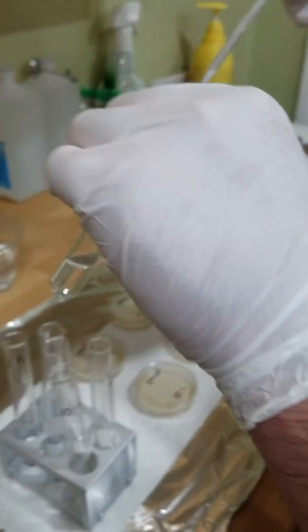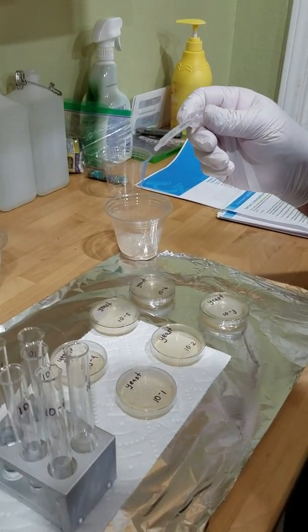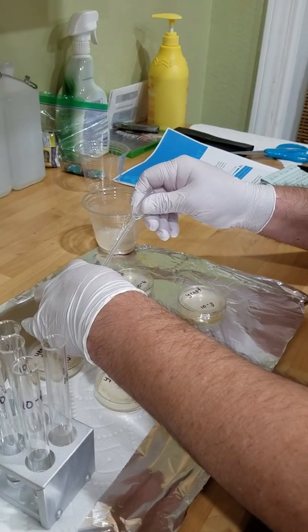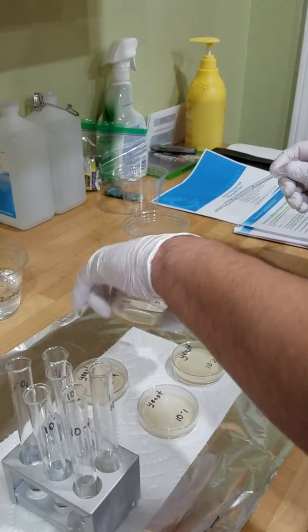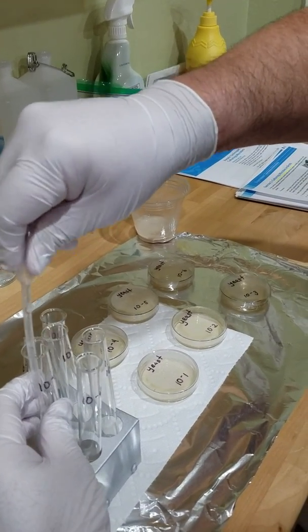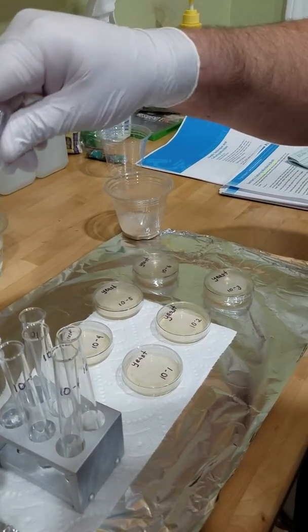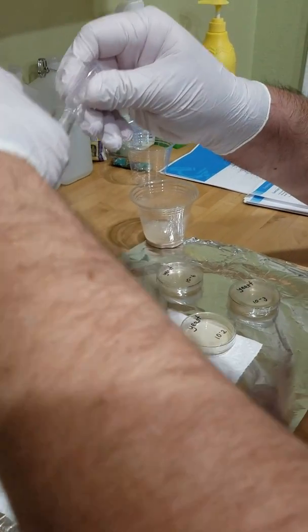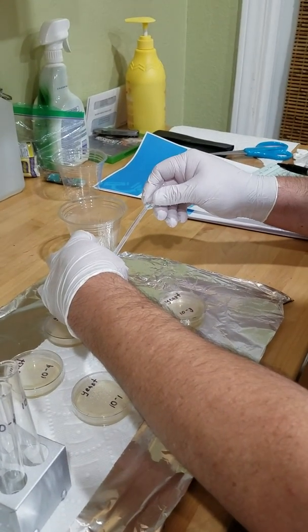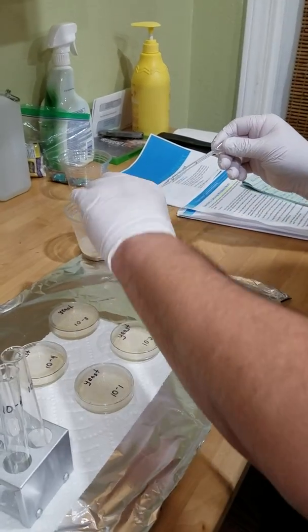Number 5. Number 5. 4. Roll that around a little bit. And last but not least, number 6. 2, 3, and 4. Get around there.